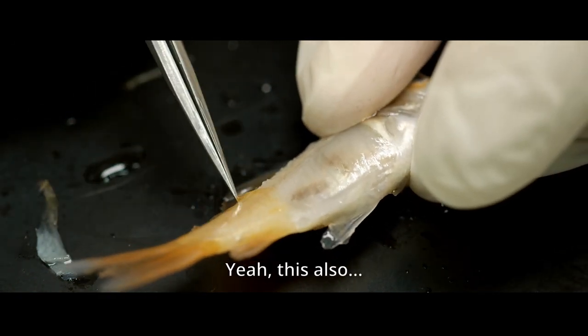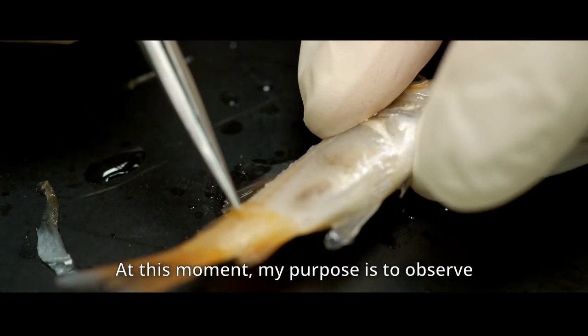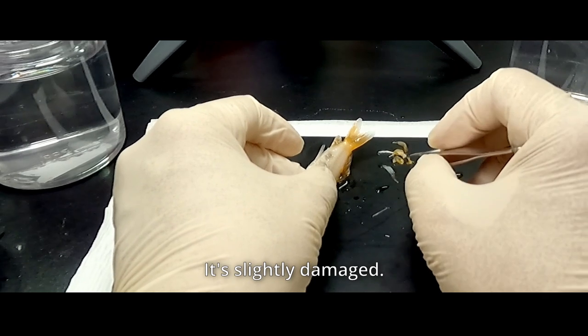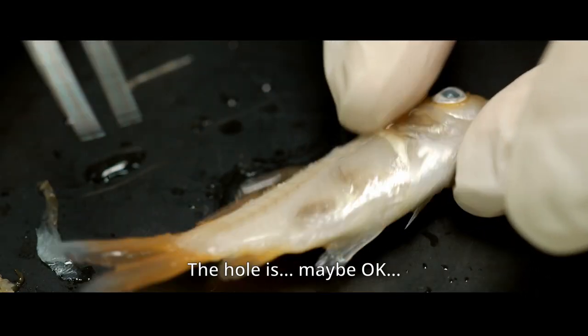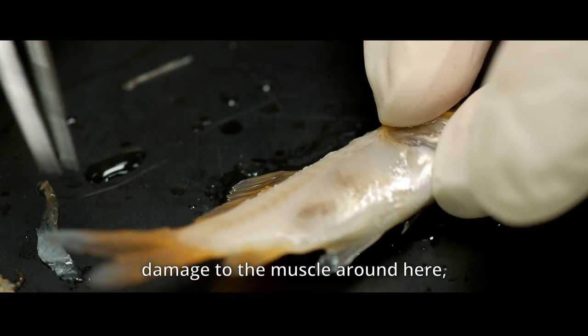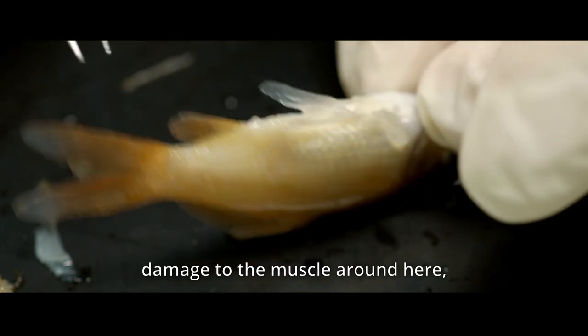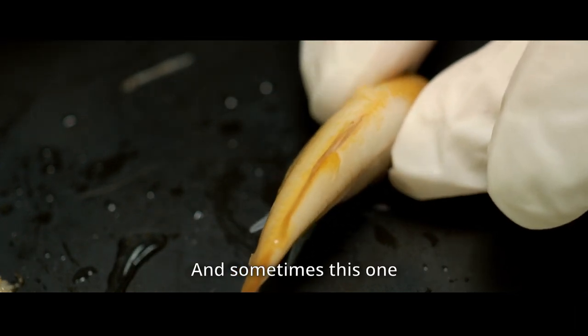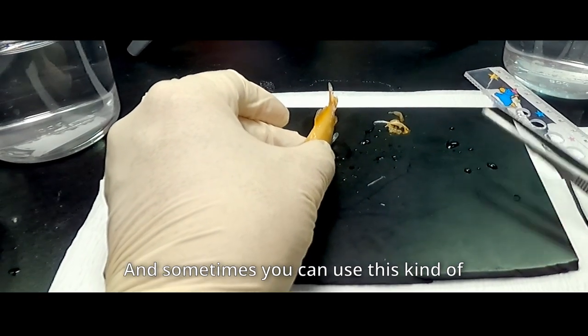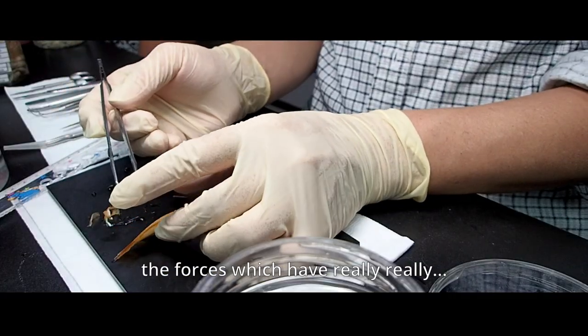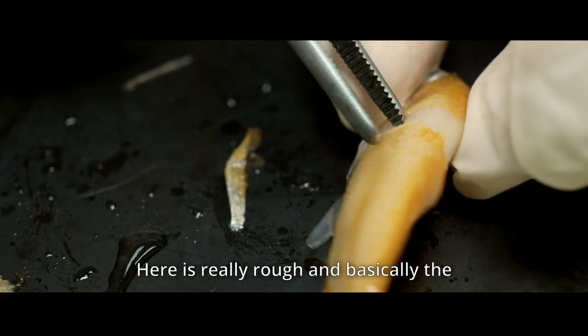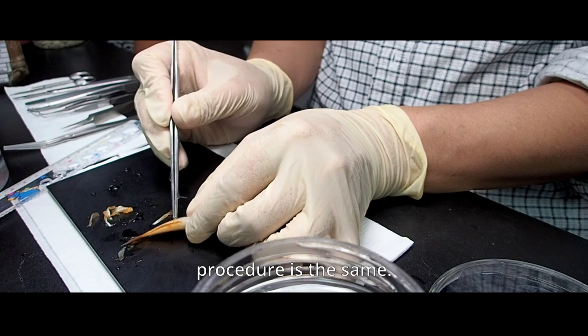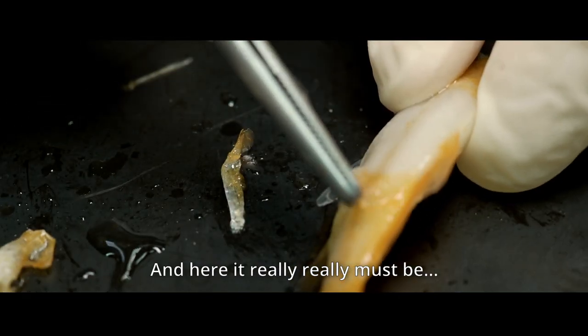At this moment, my purpose is to observe the actual skeleton. Then slightly damage to the hole is okay, but I really hope that without giving any damage to the muscle around here. And if we can remove the skin really nicely, it looks really pleasant. And sometimes, this one is nicely held like this. And sometimes, you can use this kind of forceps, which here is really rough.